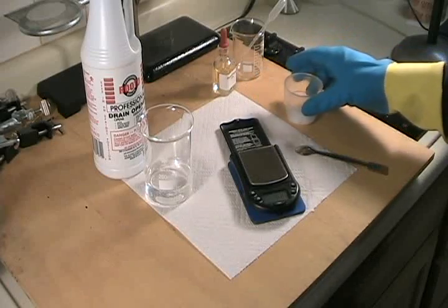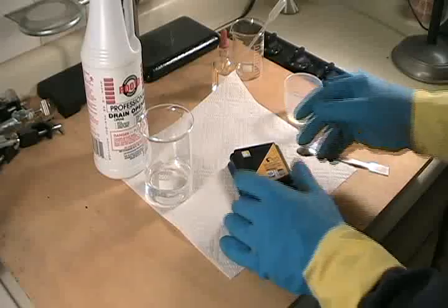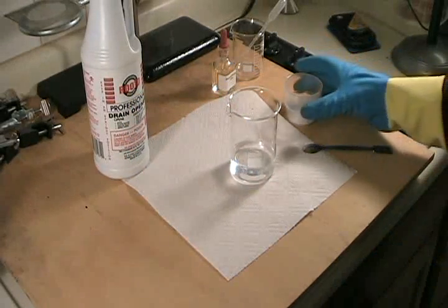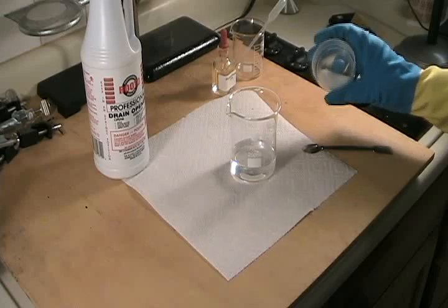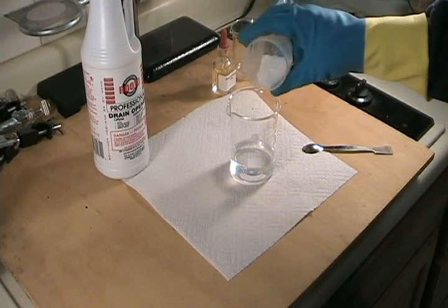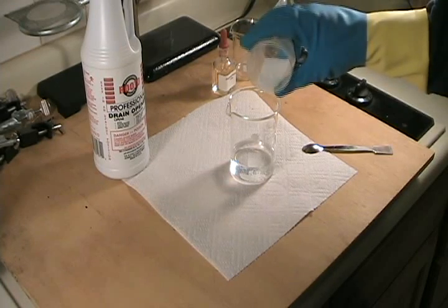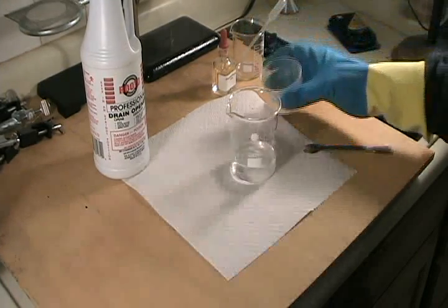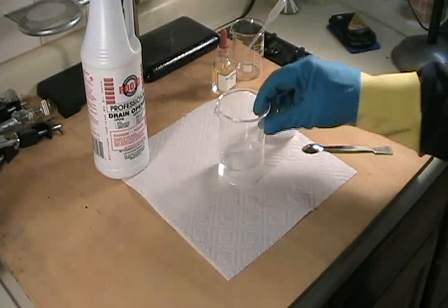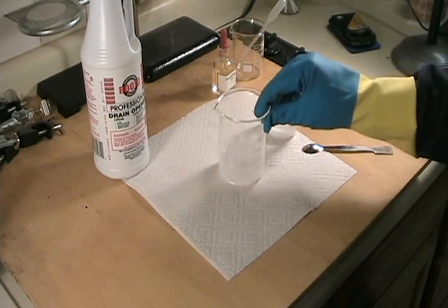Now we can begin neutralizing our acid sample. This will generate quite a bit of heat — actually adding sodium hydroxide to ordinary water generates quite a bit of heat — so we're going to add it in very small amounts. As the sodium hydroxide hits the solution we'll swirl it. You might have heard it starting to boil and form a little bit of steam.